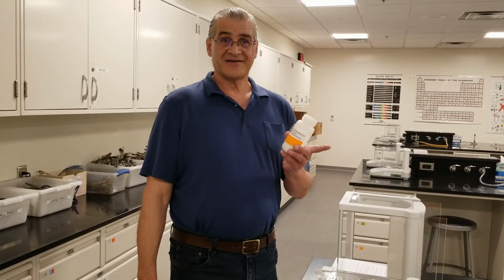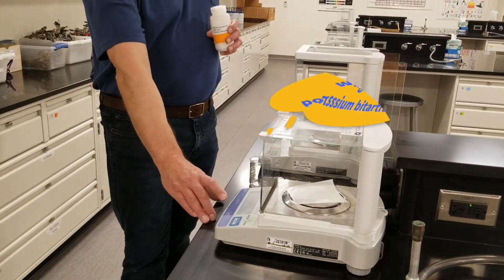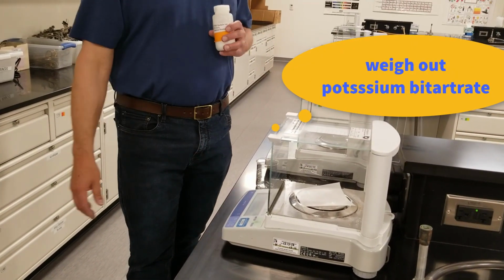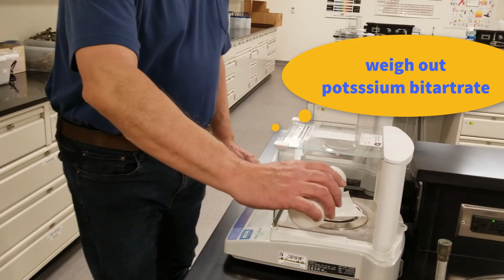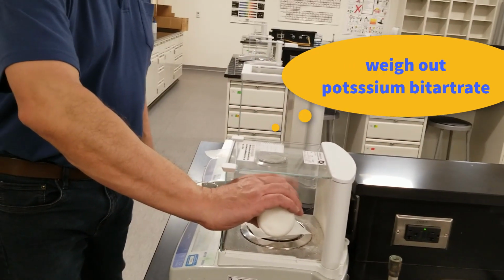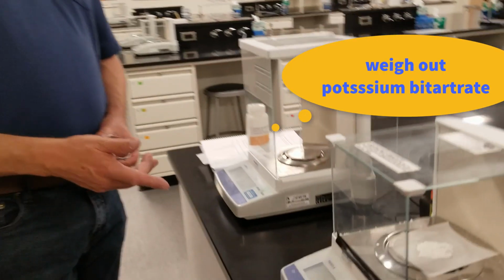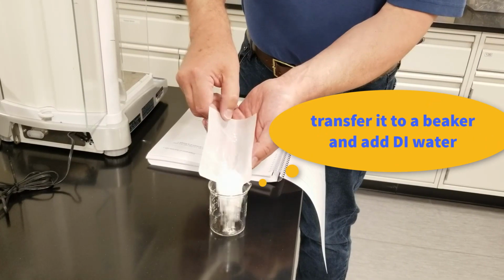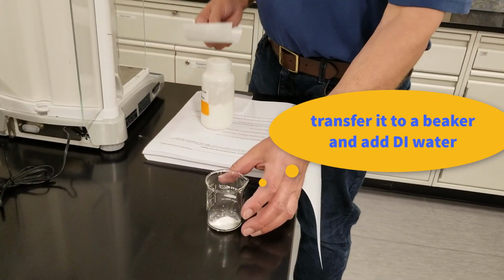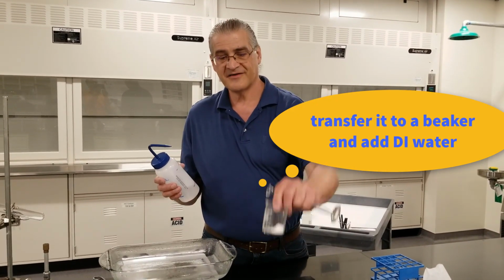So to weigh out our potassium bitartrate, we put a little piece of weighing paper on the balance and we zero it. Then we pour our potassium bitartrate in till we have the desired amount. We have 3.995 grams of the potassium bitartrate there. We'll transfer our potassium bitartrate to the large beaker. So here's our potassium bitartrate.